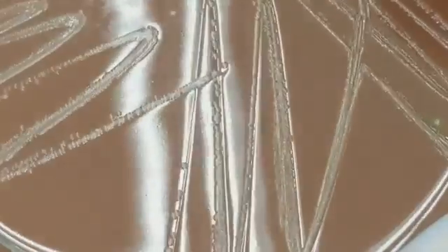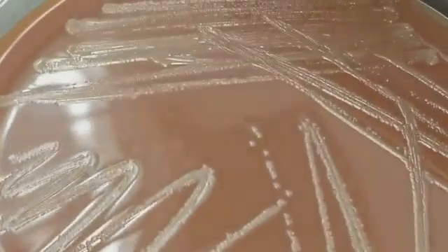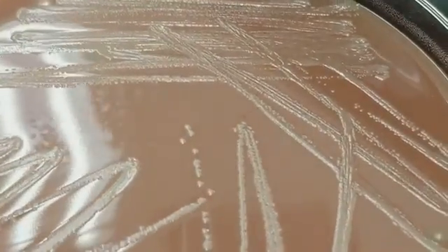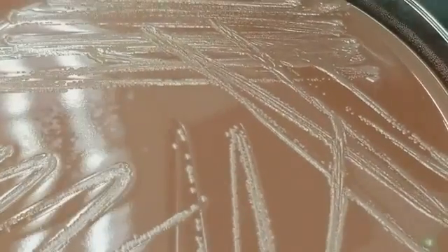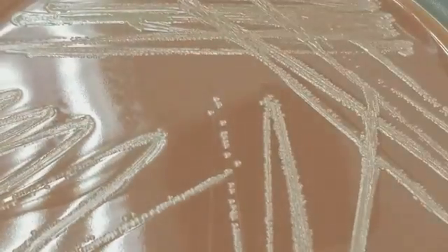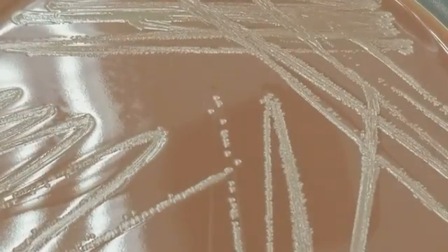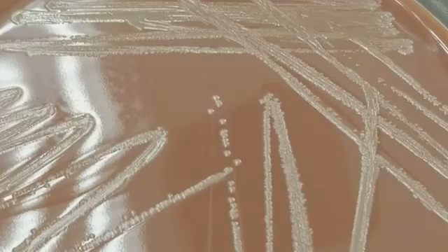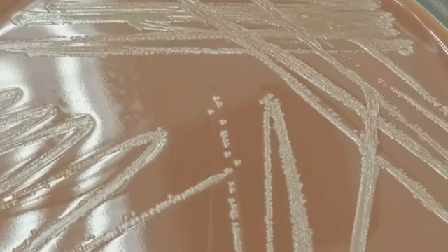But this is what Haemophilus looks like, and if it's influenzae, it's not necessarily going to grow. It's not going to grow on your blood agar plate. They would also do other testing. You've seen it in a different video, the X and V testing, to see what it needs in order to grow, and that helps speciate it. All right.